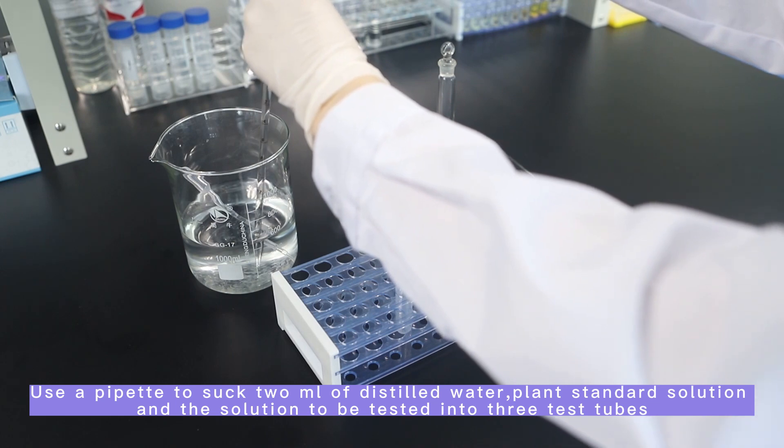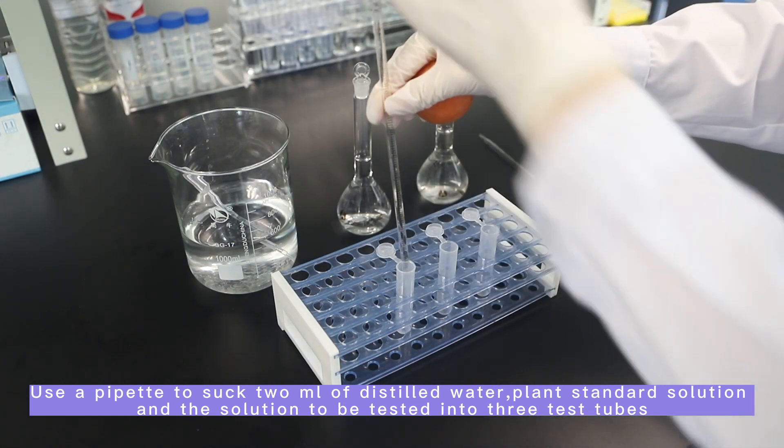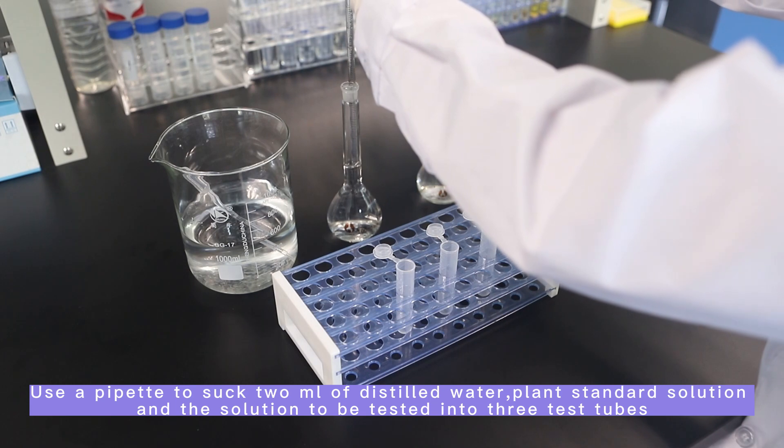Use a pipette to draw 2ml of distilled water, plant standard solution, and the solution to be tested into three test tubes.